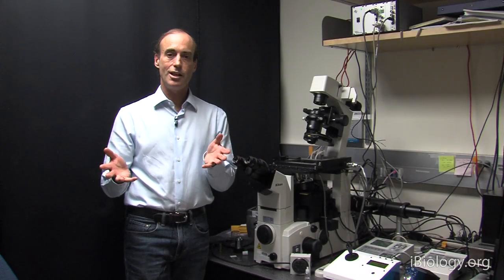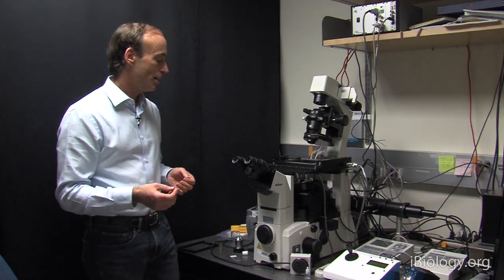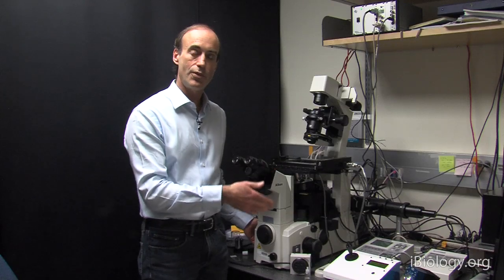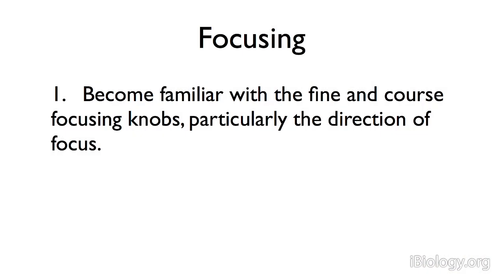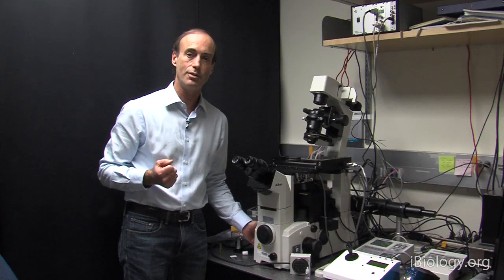So let's now review all the steps in focusing the microscope. First, look at your focusing knobs, know which one is the fine focus, which is the coarse focus. Also, get used to how the direction of turning these knobs relates to the motion of the objective lens.